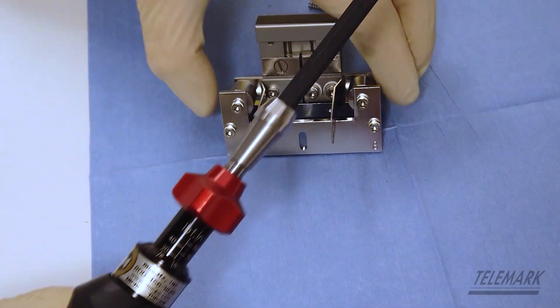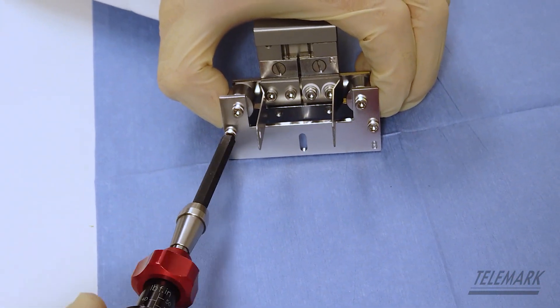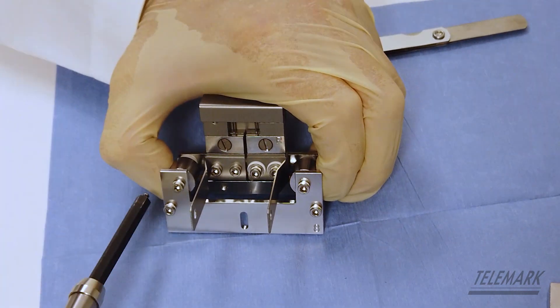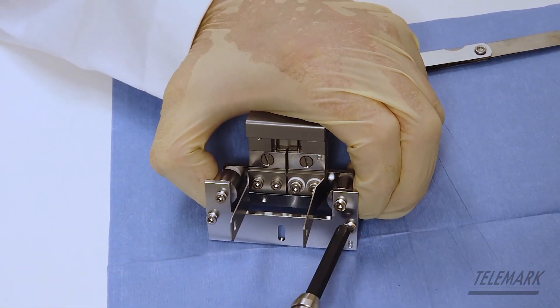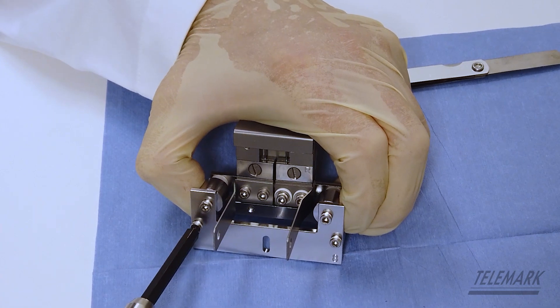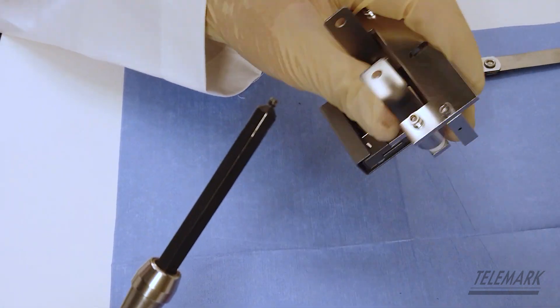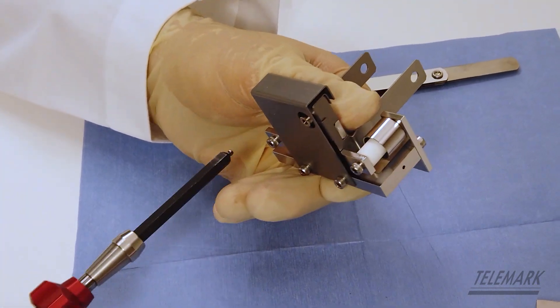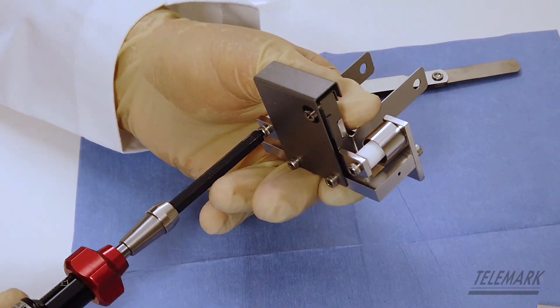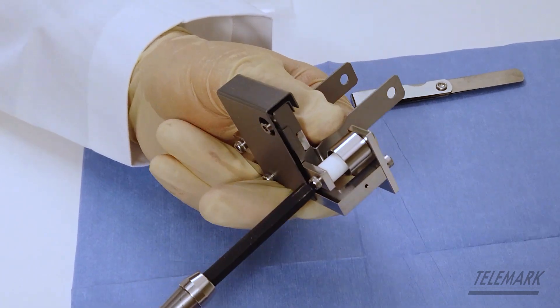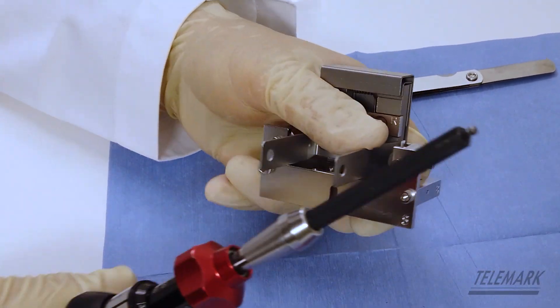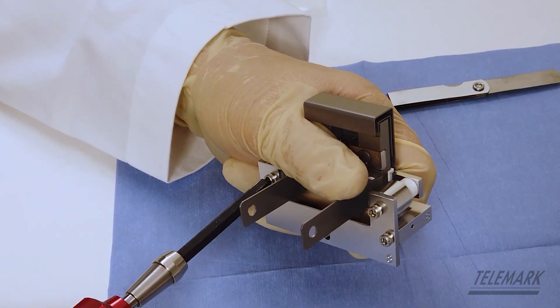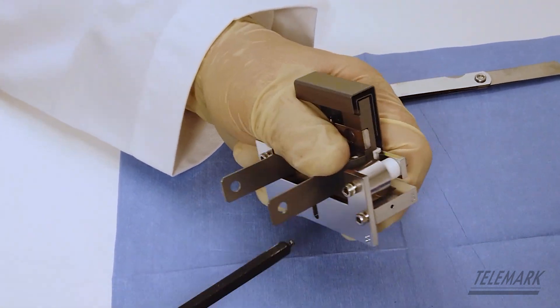Then move that off the side. Snug up the lower screws. I always put my thumb and finger in there forcing the mount bracket up with the cathode blocks. Then lock that one down. Put my thumb across the bus bars and then I snug down holding down between the mount bracket and the bus bars. Lock that down. Again, same thing on the front side screws. 632's by 3/8ths. Get them snugged up. Push down to help you square everything up.